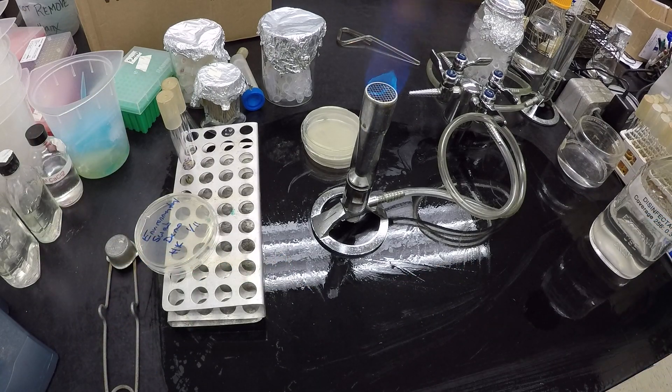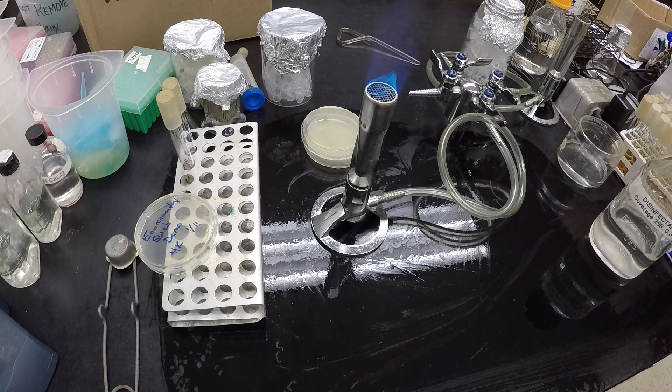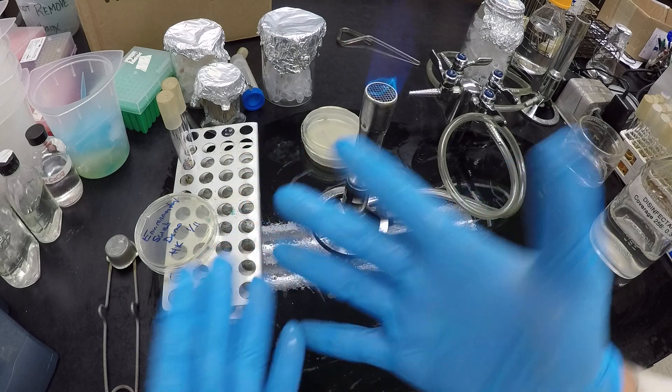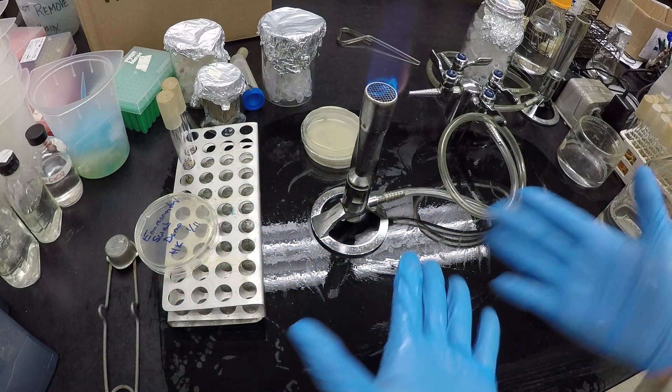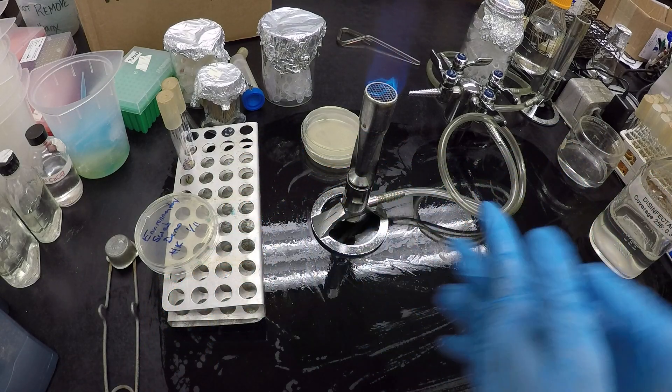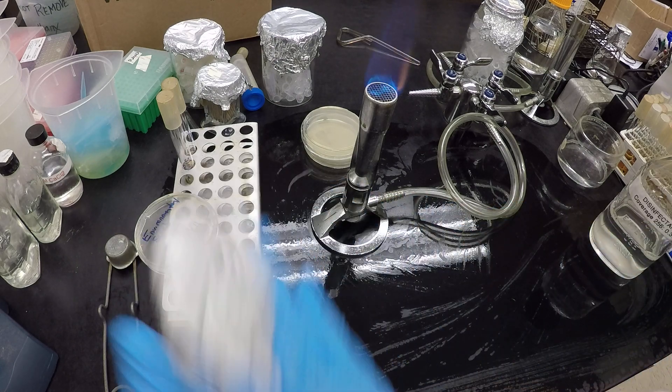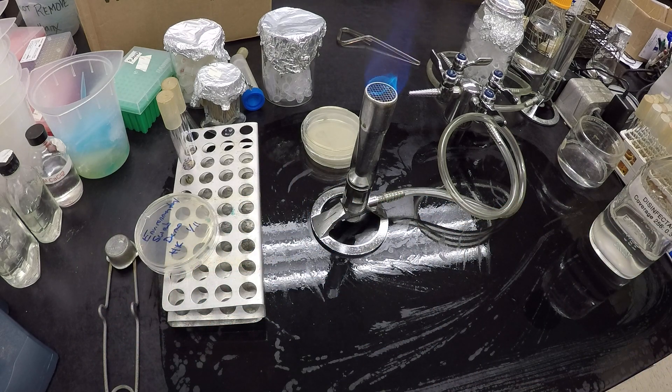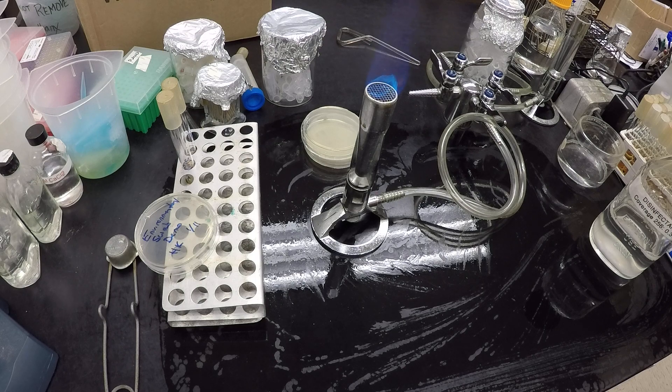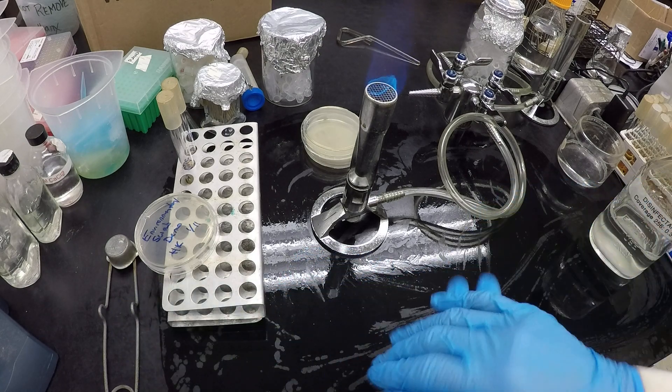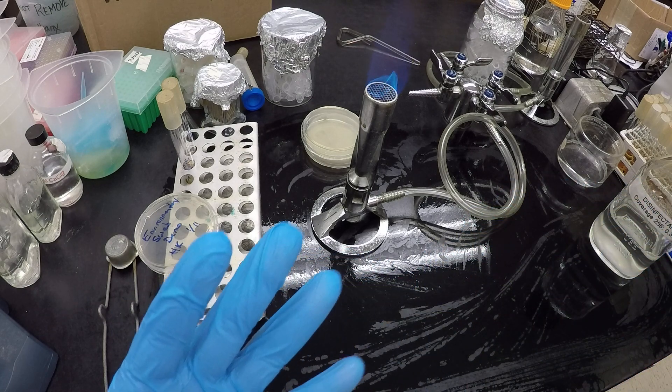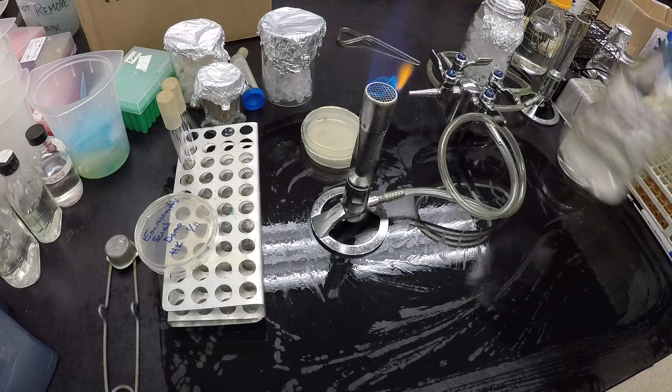Second, it's worker. So we are a huge host of contamination. So either wash your hands very well, or if you choose to wear gloves, often what I do is I'll just take some disinfectant, wipe it on my gloves, wipe it off with a paper towel. This can go in the trash, and then we're good to go. So now we are as aseptic or as disinfected as possible.